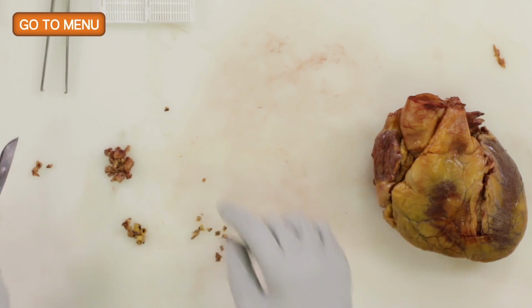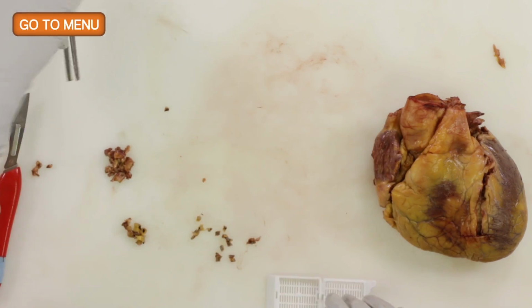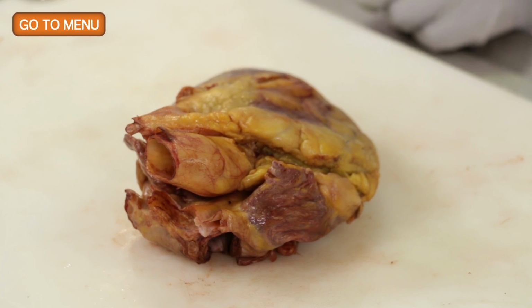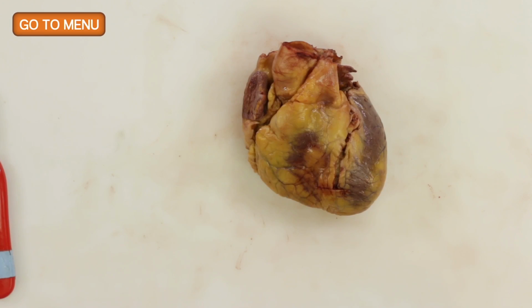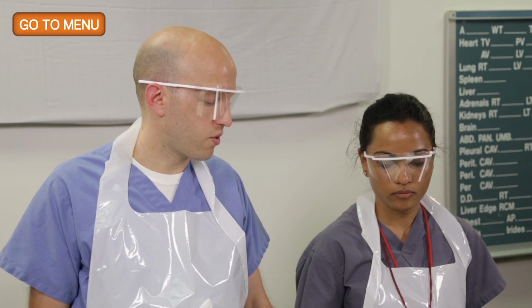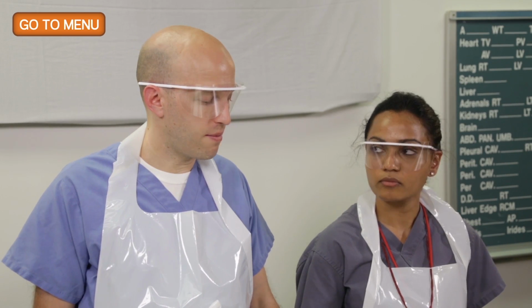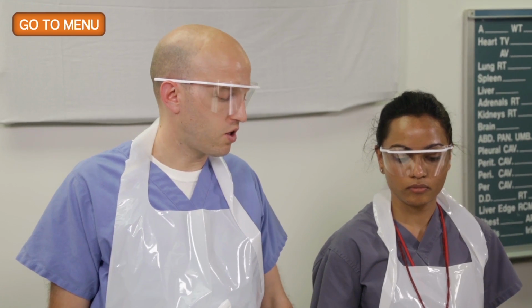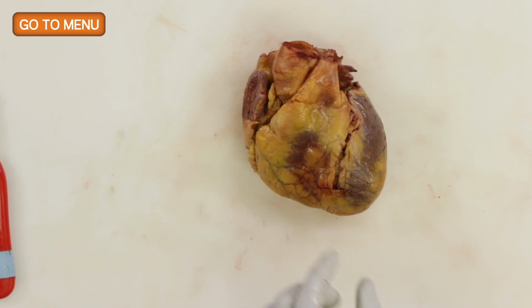So that is the coronary portion. And now we're going to return to the heart to evaluate the ventricular wall. So here again we have the heart in anatomic position with the anterior facing towards us. And if this were a case of coronary artery disease, we're worried about myocardial infarct. We want to bread loaf the apex of the heart up to a centimeter or two below the valves.